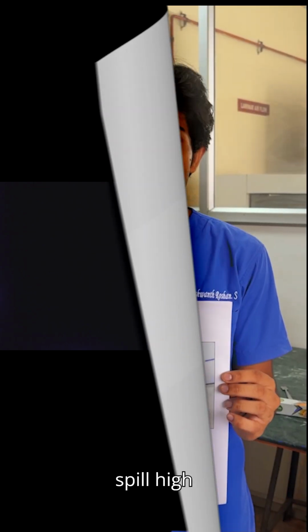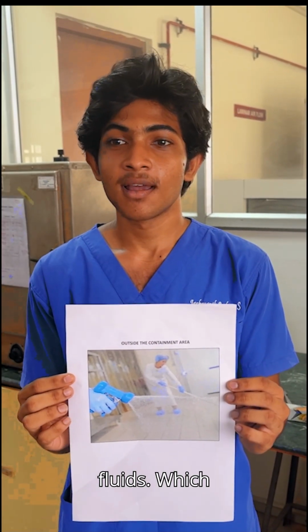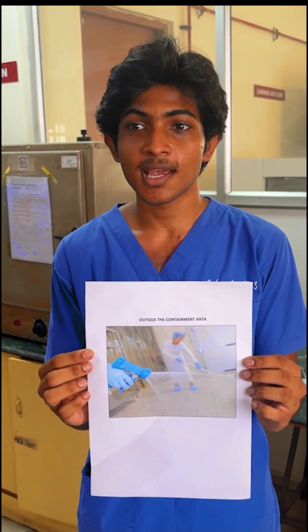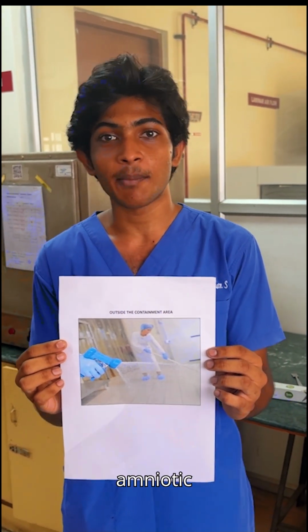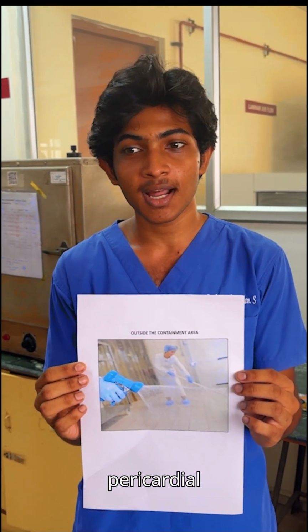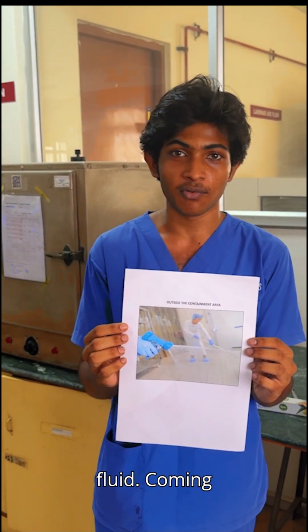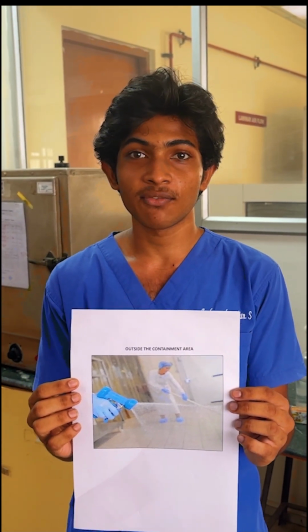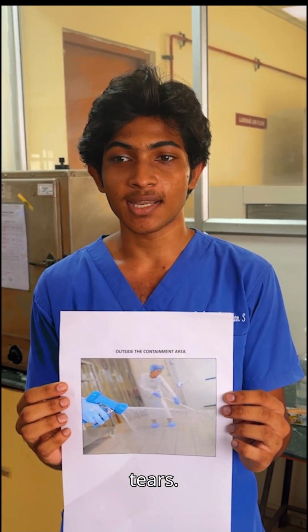Different types of biospill. High risk body fluids include blood, any visibly blood-stained fluid or substance, semen, vaginal secretions, amniotic fluid, CSF, pericardial fluid, pleural fluid, and synovial fluid. Coming on to the low risk fluids: saliva, urine, feces, vomit, sweat, and tears.